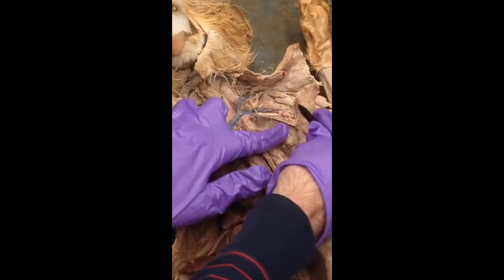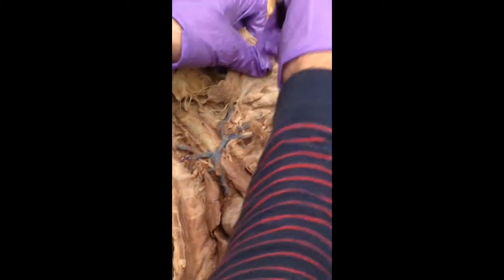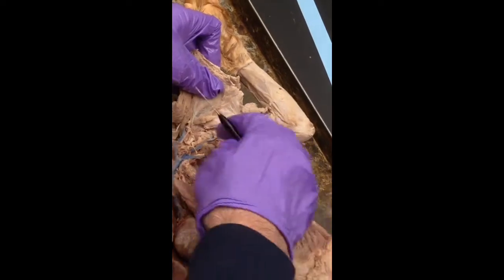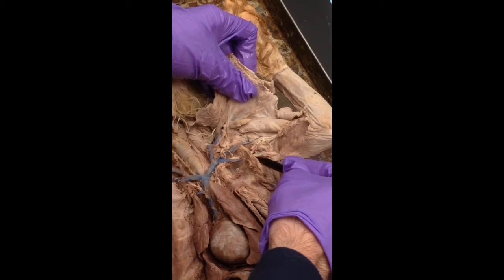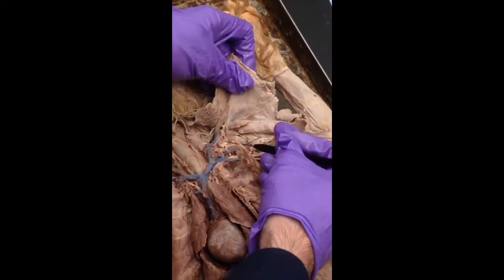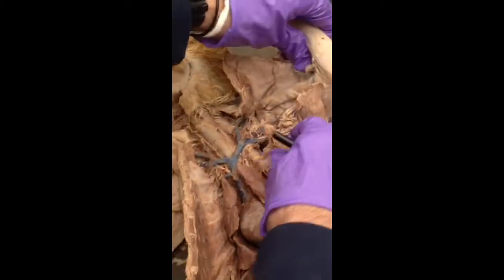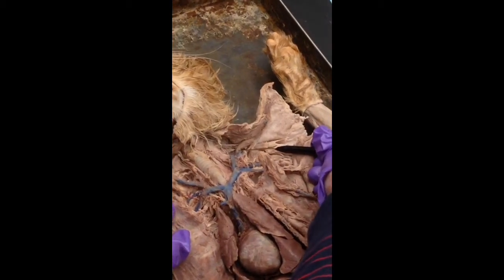All right, let's do this side. So for a little bit in here, it's axillary, but once it's down to there, it's going to be the brachial arteries and veins. Right, you've got a subscapular artery and vein. You can only see the veins here. They're really nice and blue. But there are arteries in there if we find a cat that has them. So brachial goes to the arm. The subscapular goes underneath the scapula, which is right under here. So there it is, going right underneath the scapula. And then you have a transverse scapular artery and vein.